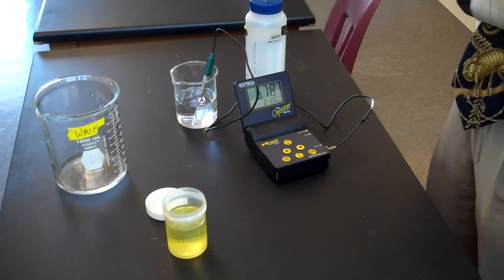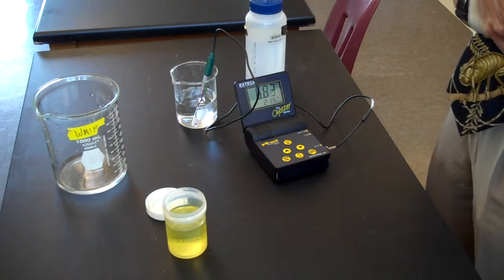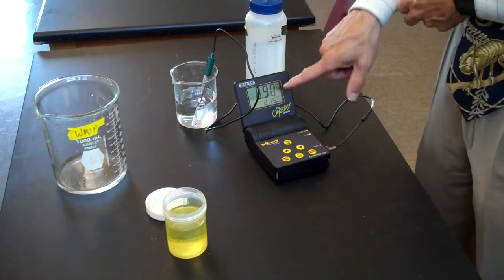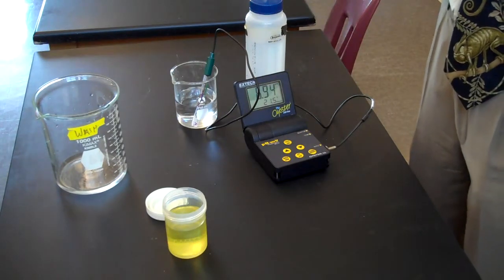Right now I'm just using tap water so I expect it to be close to neutrality. Once I have a stable reading I'll say that is the pH of my solution.